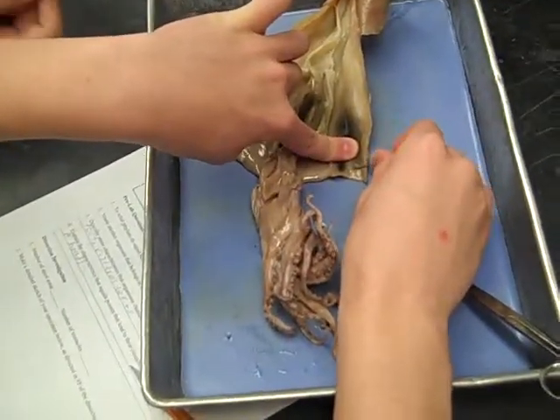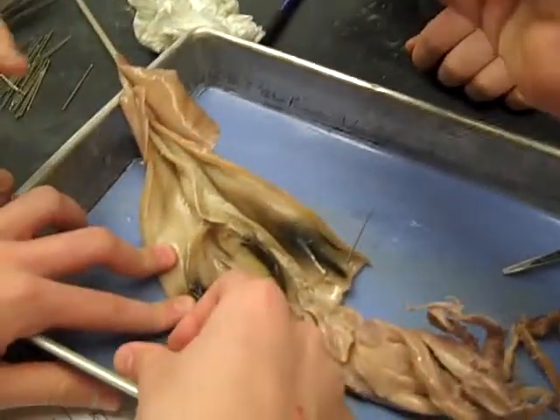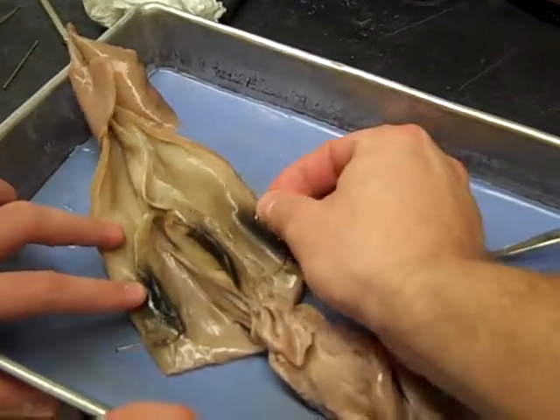This thing is rubbery, that's what you meant. So that's what you meant by extreme angles. And even more extreme, let me see one of those pins. Basically sideways? So you take this pin, and pretty much sideways, and you can actually stab it through the rubber.